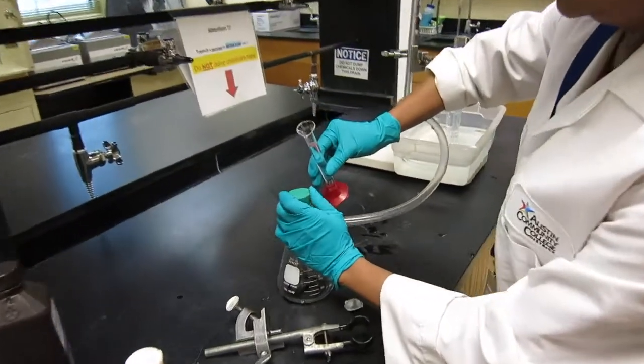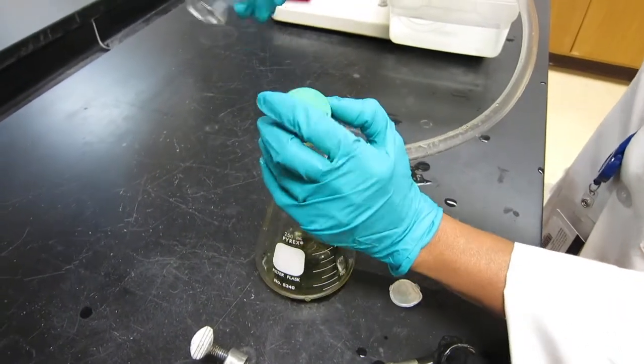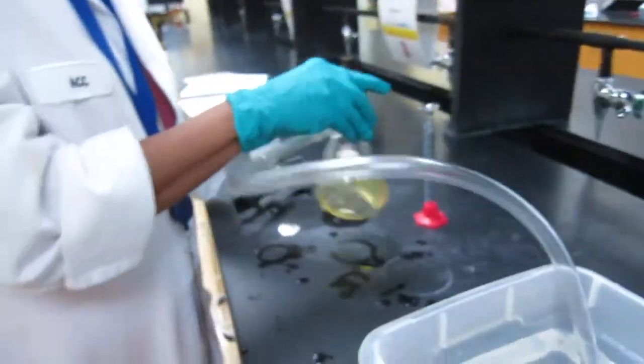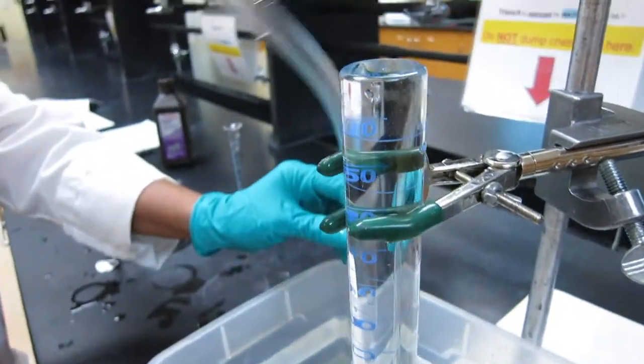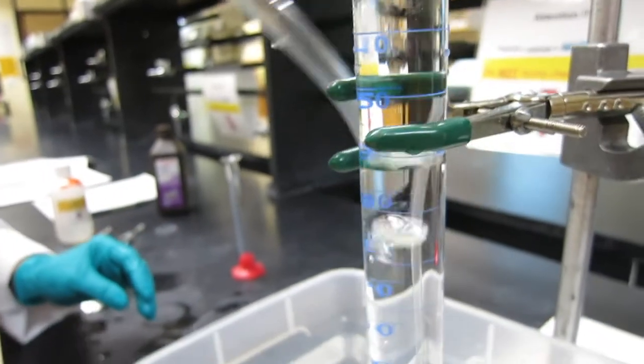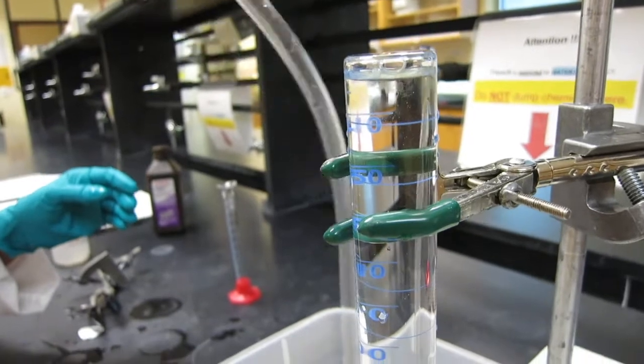So we're going to start the reaction. We're going to pour it in. As we see here, we're still full of water, and then we're shaking to get the reaction started. There you go, there's a gas form from the reaction.